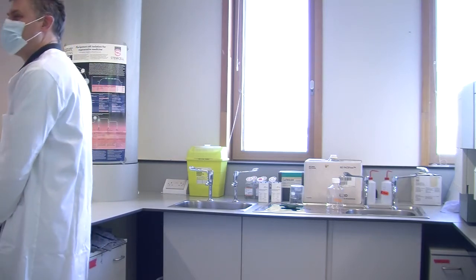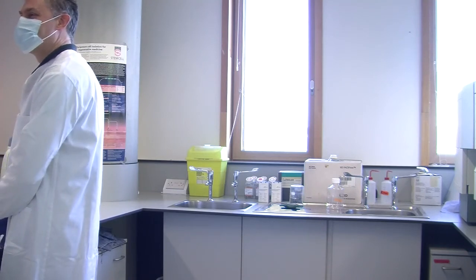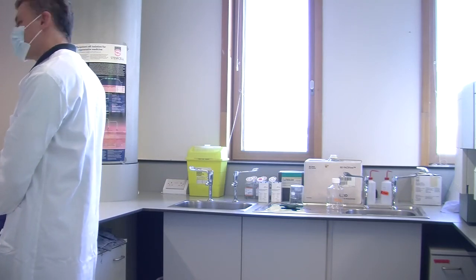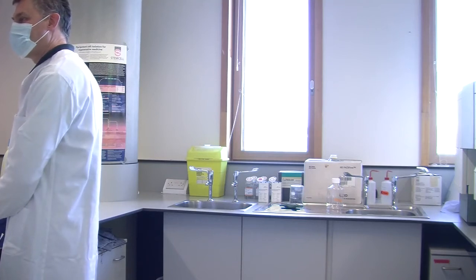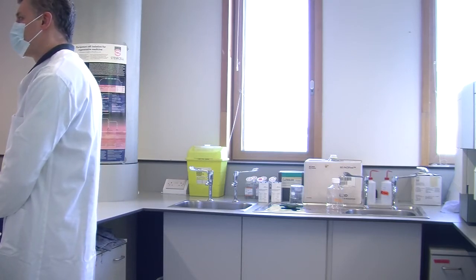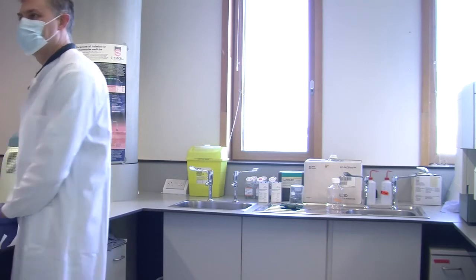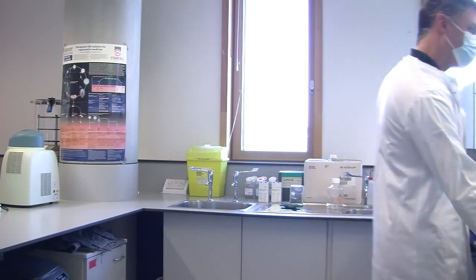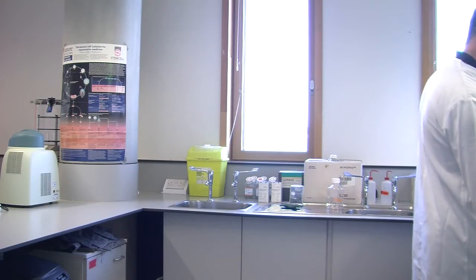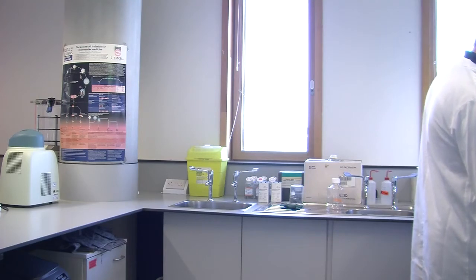Okay. So aspirate all the PBS first. Use a different tip for each one of the samples because we have different cells. Discard all of it, and after, I will have here the fixation buffer that you will need to add, 500 microliters to each one of your tubes. Because we just have it in here, we'll need to make sure that all will go around. There is 1 milliliter in total.